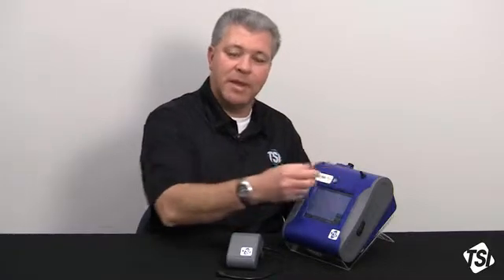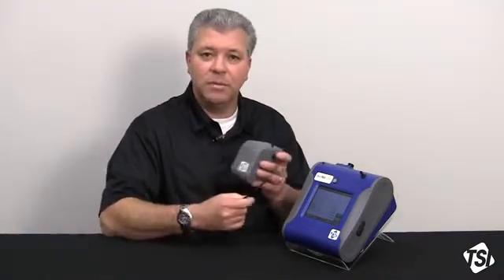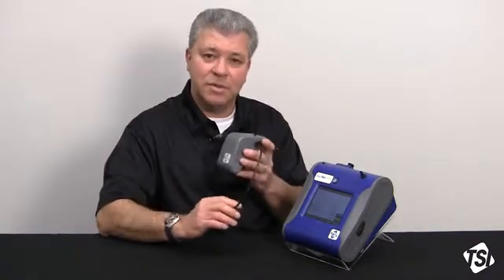You can't go out, stop your instrument, zero it, and then restart it again. You've lost the continuity of your sample. So now you have multiple data sets, and so on and so forth. This will allow you to run continuous sampled data sets. It will also allow you to zero during longer periods, number one, for electronics drift.